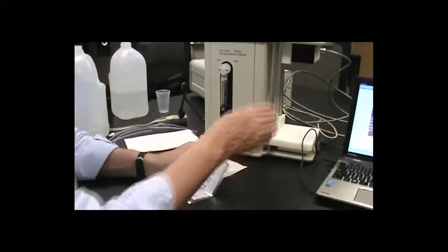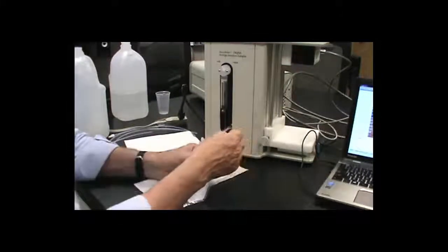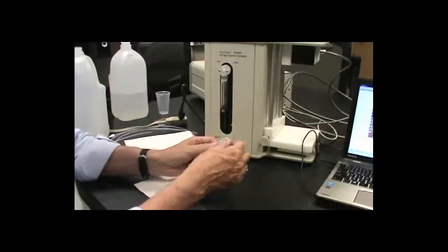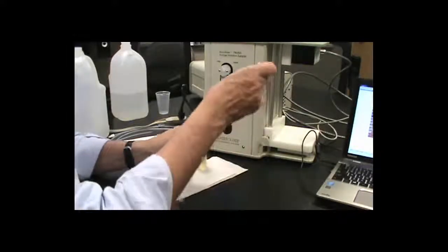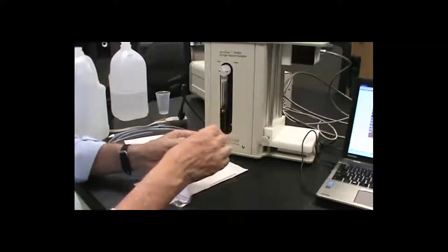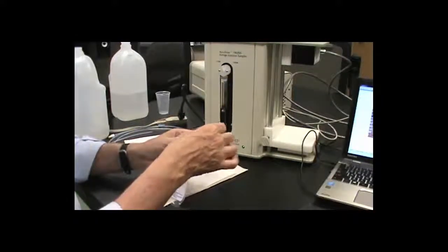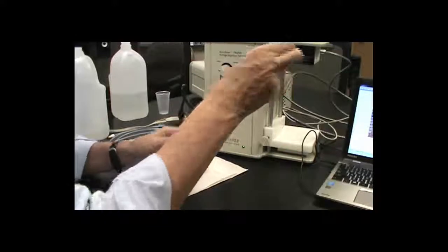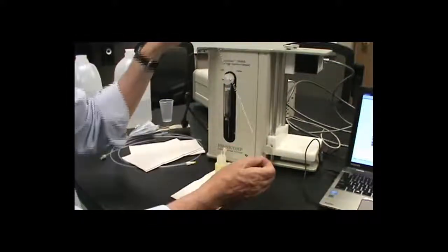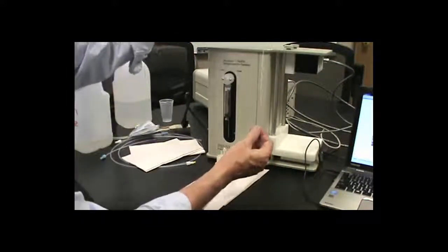Before we begin, I'm just going to give the sensor a quick clean. This is something you should know how to do for when you need to clean the sensor on some kind of regular basis. I've removed one strand of the cleaning cloth.